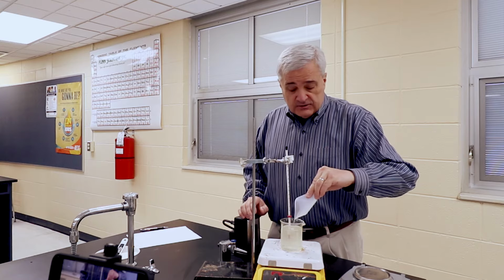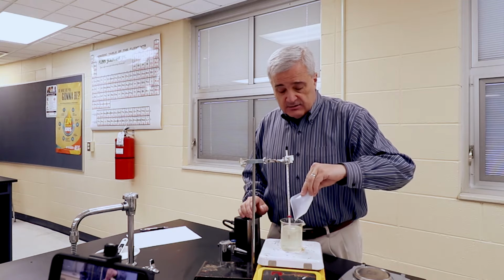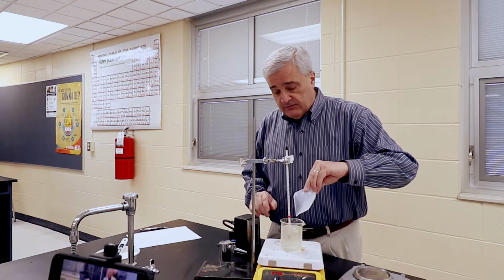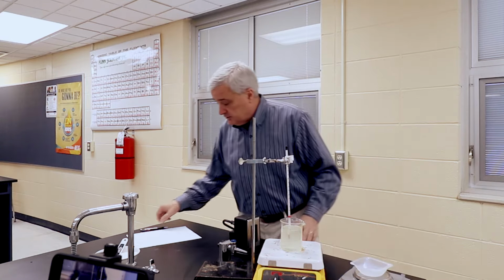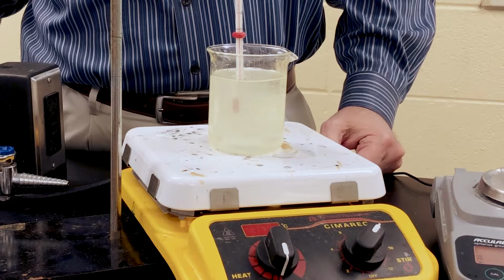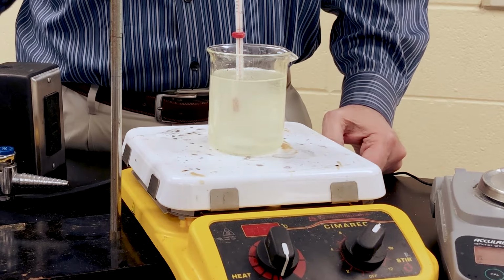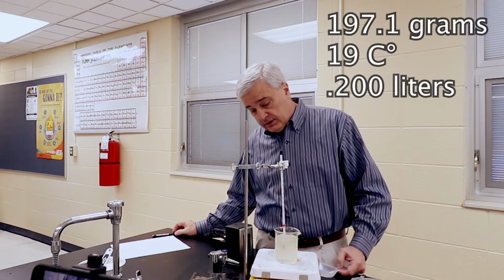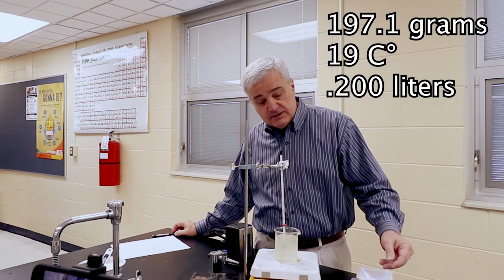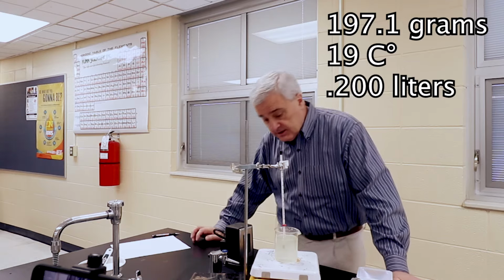And I almost thought the last time was saturation. I feel like if we're not there now, we are so super close. And with that addition brings us to 197.1 grams at 19 degrees Celsius.